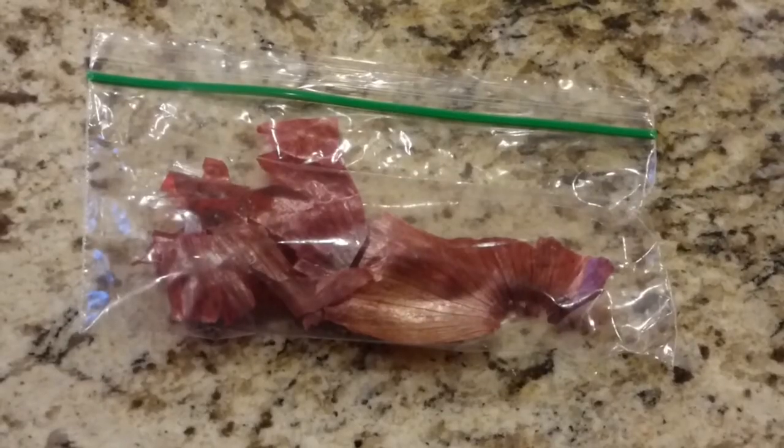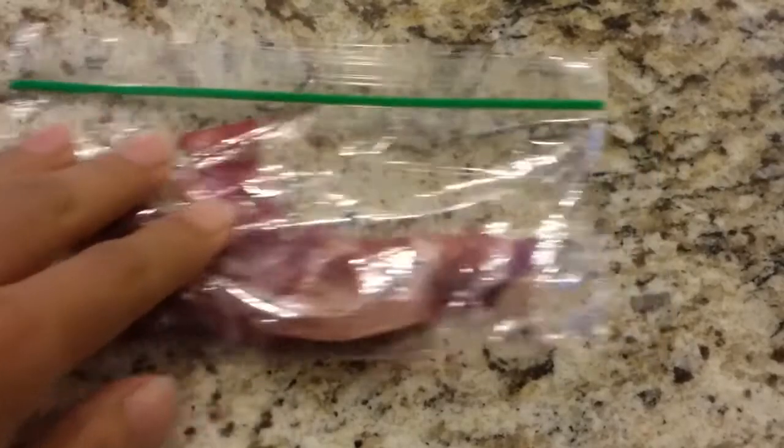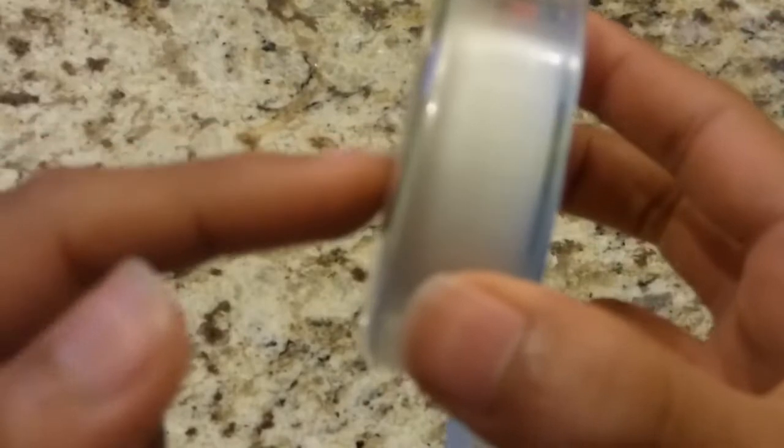First off, let's gather our materials. We're going to need our sample, I'm using onion epidermis, which is the outer shell of an onion. Clear tape, make sure it's clear so that ample light illuminates your subject.